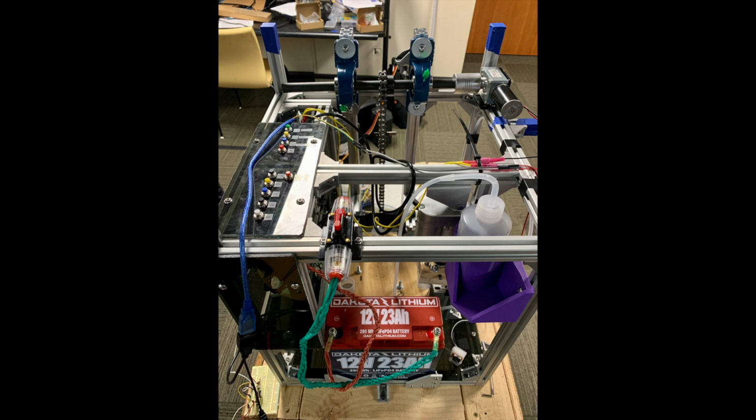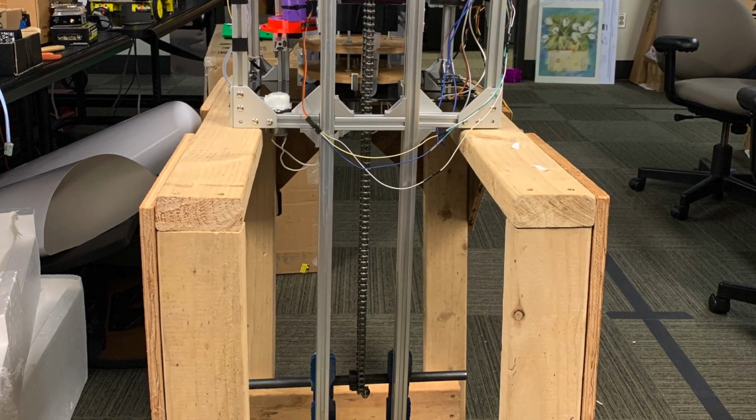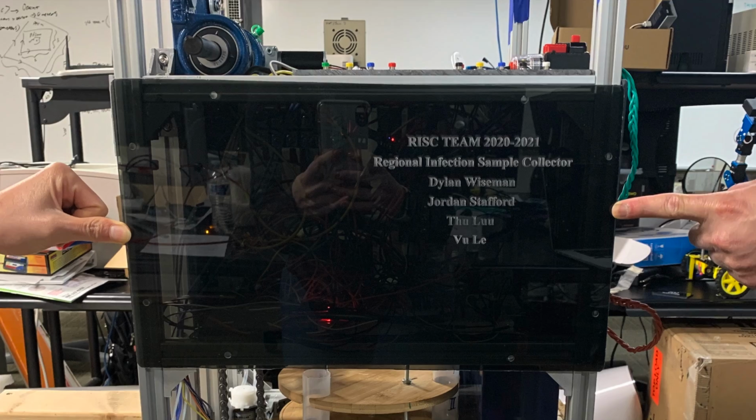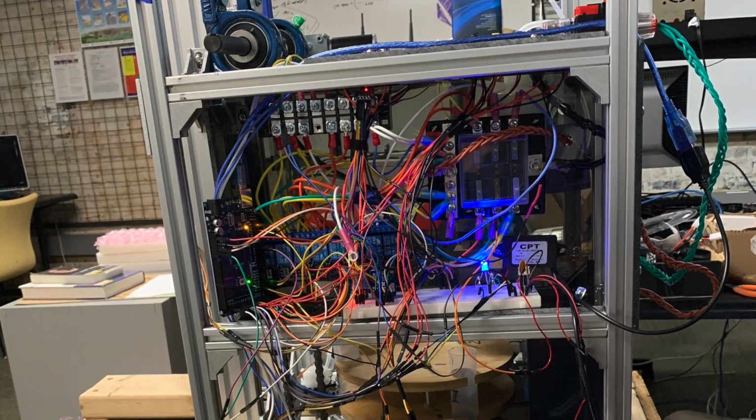Although this device is a prototype design, it can easily be expanded to a full-scale device ready to be deployed into the sewer by making a few adjustments. The conveyor can be extended for the length of the sewer chosen for sampling. The casing for the device can be updated to waterproof materials, and the wiring can be soldered.